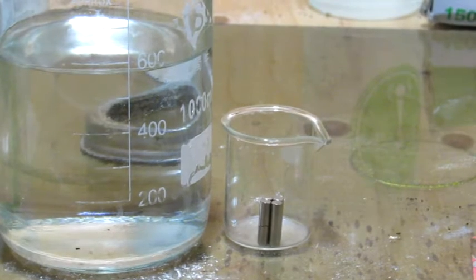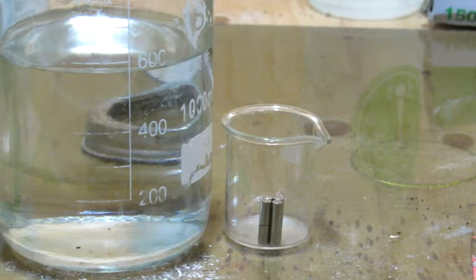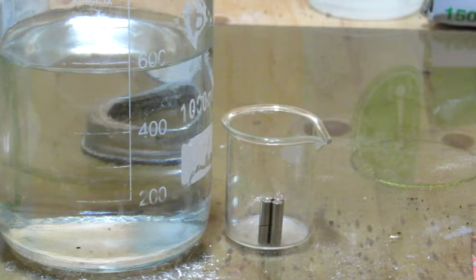This reaction does proceed at room temperature, however, quite slowly, so we're going to need to be heating it up just to speed up the reaction.